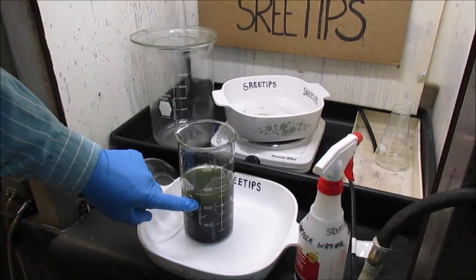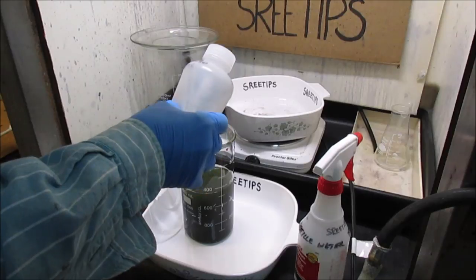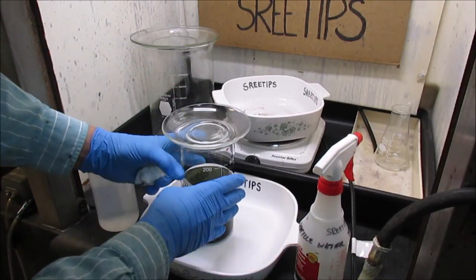I've got our first extraction right here. I'm going to set this off to the side and let it settle out. And then we'll get the liquid off there because it's got precious metals in it.